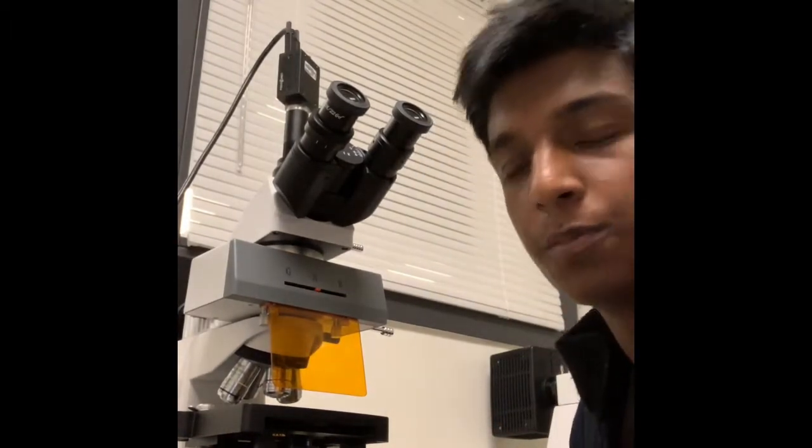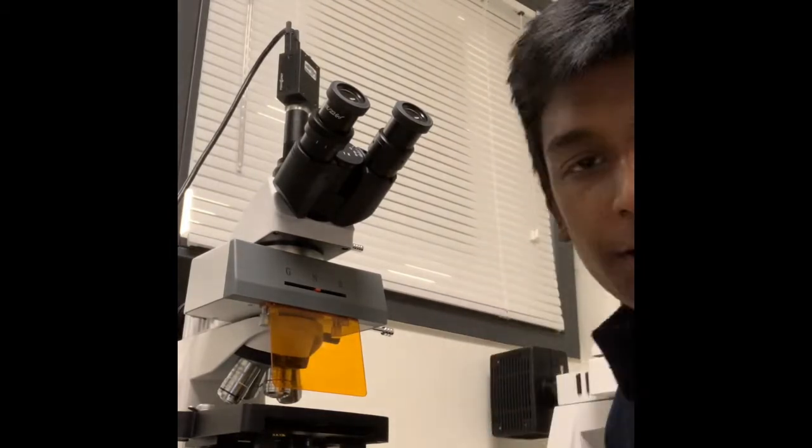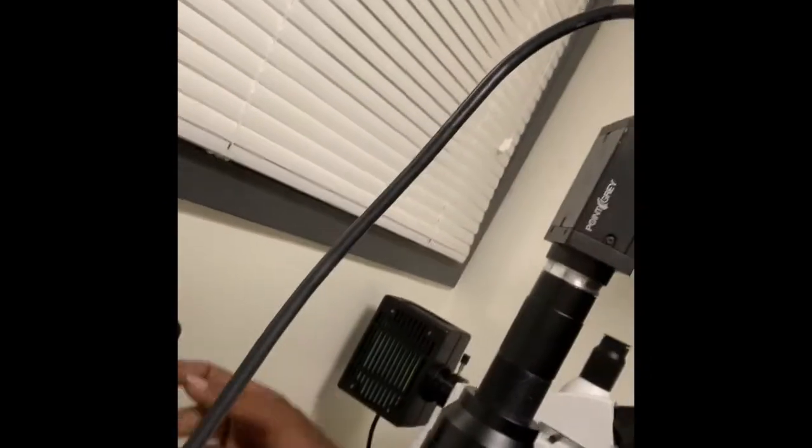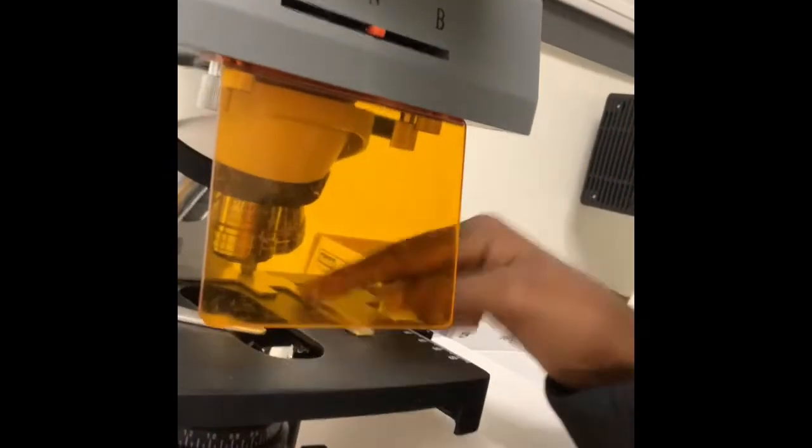And the way this microscope works is it shoots these different photons of light, and that's how you get the neurons to fluoresce. So essentially what the power box does is it allows all the different wavelengths of light to be emitted through here, which will then be filtered through this area. And then obviously towards the end it'll be shot out right around here onto your specimen or microscope slide.